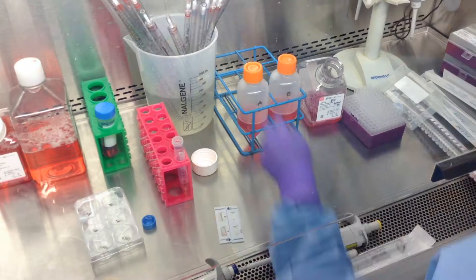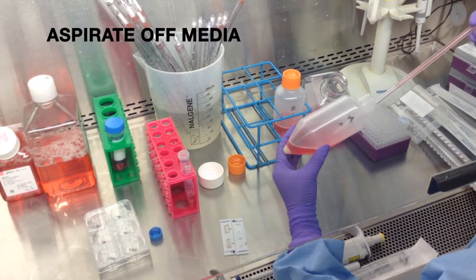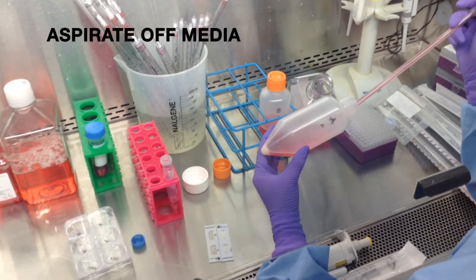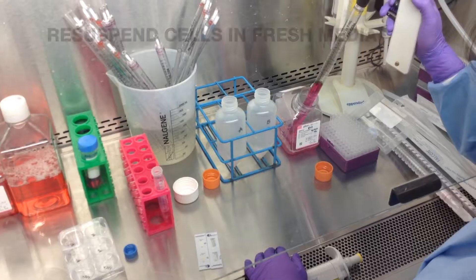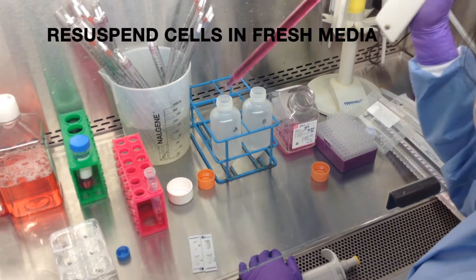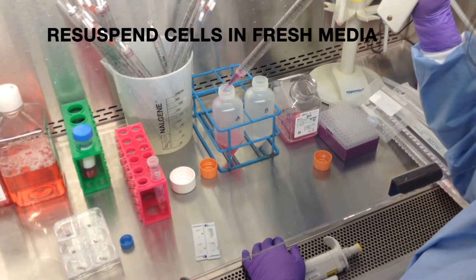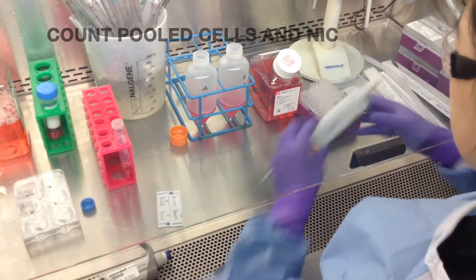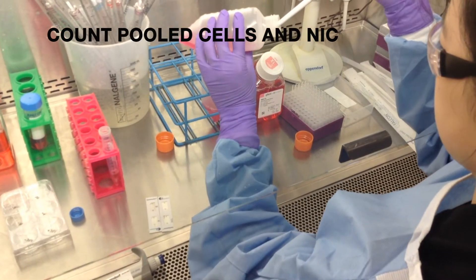Spin the conicals at 1500 RPM for 5 minutes, aspirate off the media, and re-suspend in fresh media. Re-suspend the cells thoroughly.